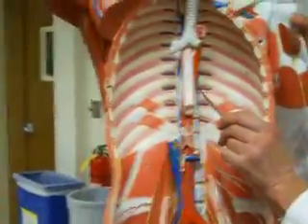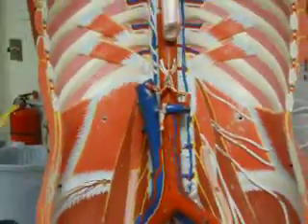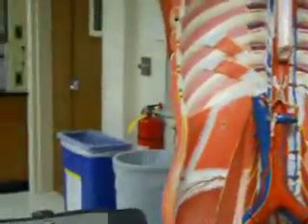Dissection right now. Here we have the descending aorta. I would not ask that on the model. I've got a good wet specimen with the descending aorta, but I can't show these.